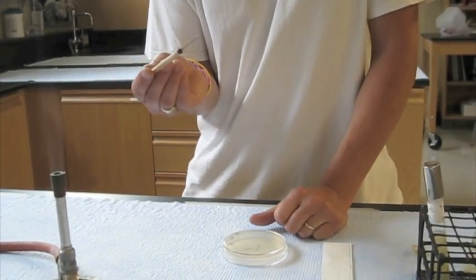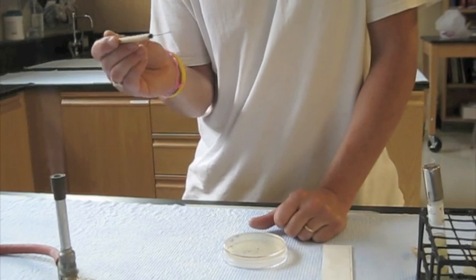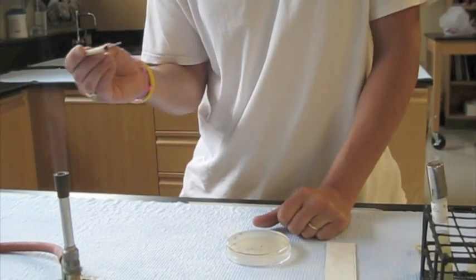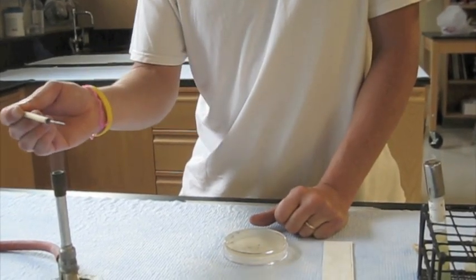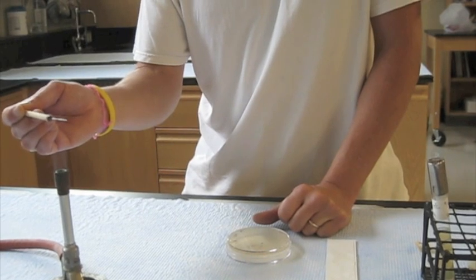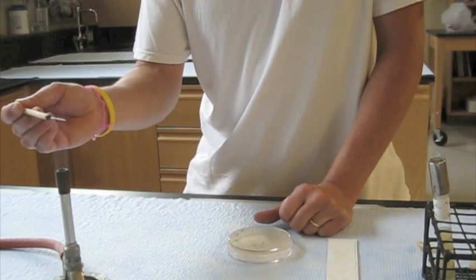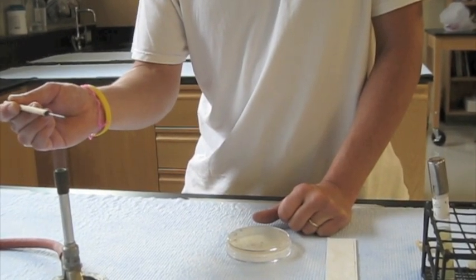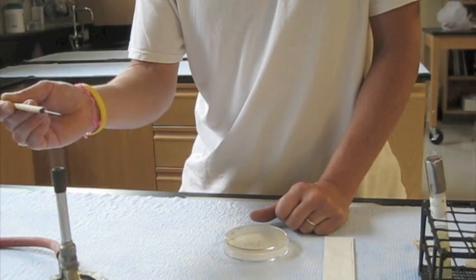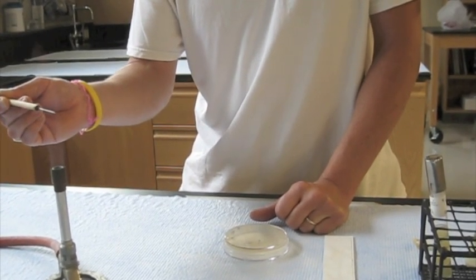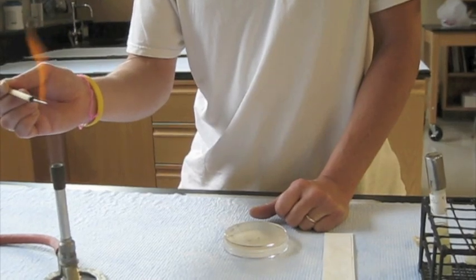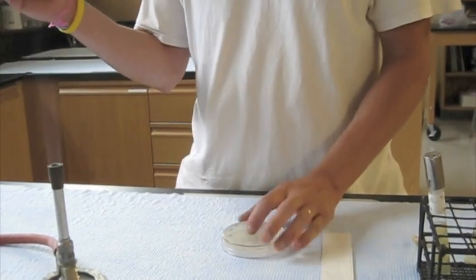Sterilizing the needle, very much like sterilizing the loop into the flame, drawing it out slowly to get it to sterilize. So I'm going to put it in the flame here. This may not get red hot, depending on how thick these needles are. At the end, it's pretty hot and red. That will cool off.